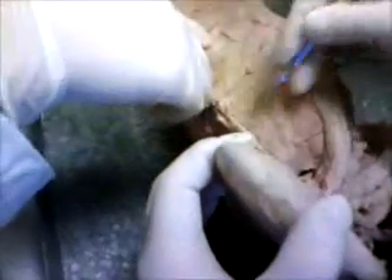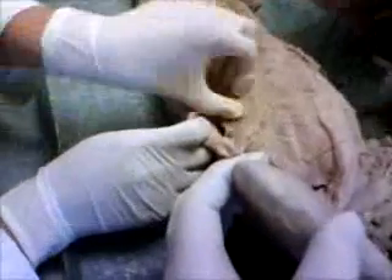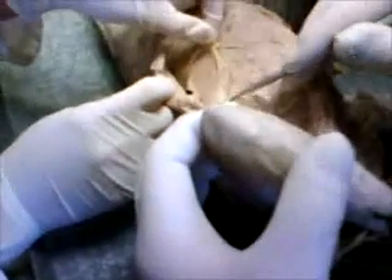Okay, this is the scapula, near the back of the scapula. You've got a lot of fascia and stuff you're going to have to get off here. Some of that is fat, some of it's fascia. When you get that off, then you can start to see that the fibers — here's the gap between the anterior and posterior. This is all posterior that inserts right there. The anterior inserts down there. There's your gap.